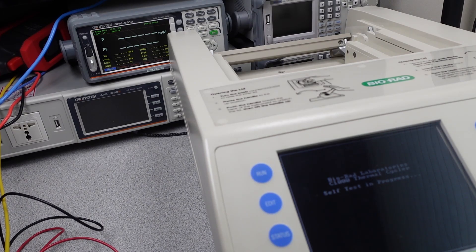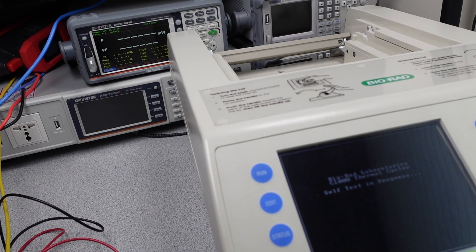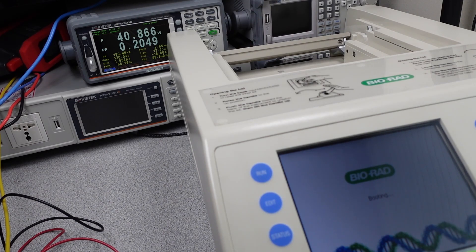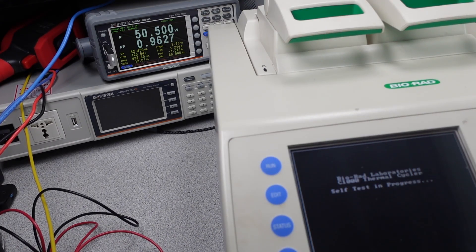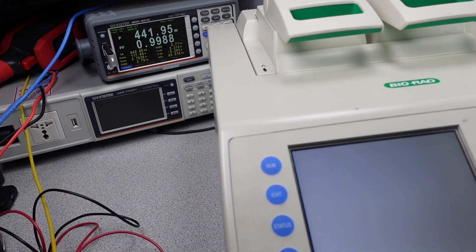Thanks for that. It is great to learn a little of the process this machine actually performs and why it exists. That was not a difficult repair in the end. The thermal cycler is back in the lab and has been operating experiments every day — this is the best possible outcome, but it doesn't always go this way. The lab had more than one of these machines and one of them suffered more damage, warranting further exploration to figure out why the power supply isn't starting up. My guess is the larger capacitors have also started to fail or something else in the circuit has been damaged by the high current. But the first machine is fully repaired and operating and has been going for many months in the lab now. It goes to show that a simple repair of a complex electronic device is possible. It probably wouldn't be a bad idea to recap the whole machine, but then that $2,200 repair cost starts to make sense. In this case though, $10 to make one machine fully operable — I think that is a success.